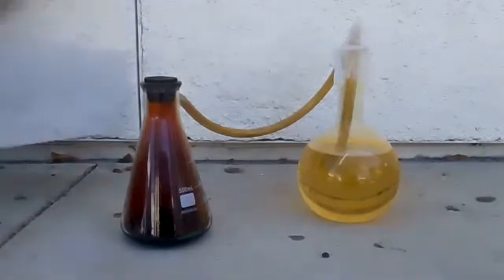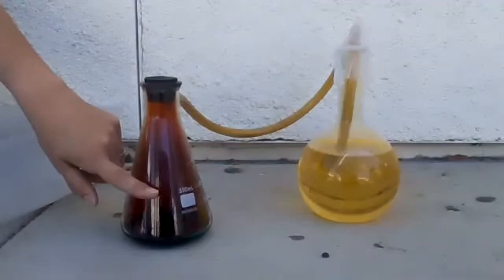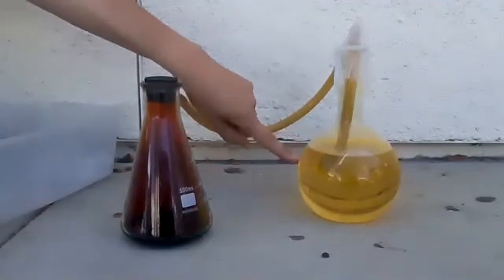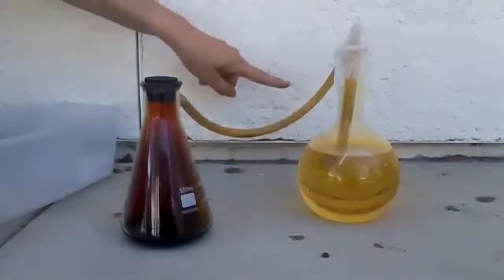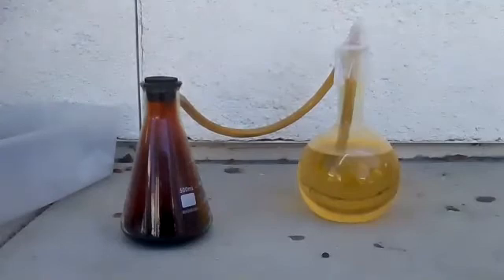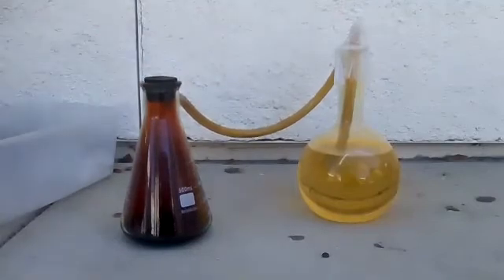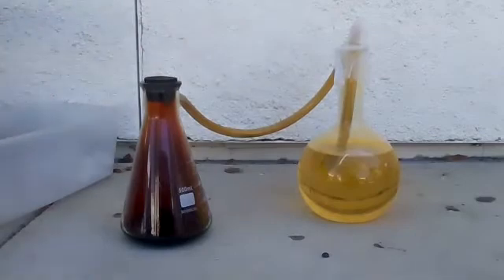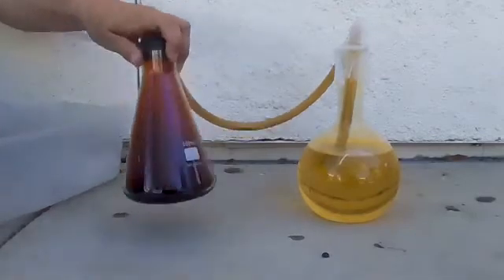It's going to start to shrink the gas, which is going to start to pull the solution in, and then all of a sudden it's slow, slow, slow — and then once it gets going it just goes whoosh, and it all comes in and makes a really pretty color change.